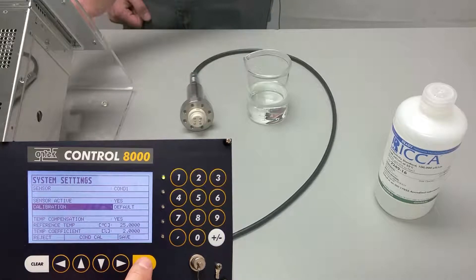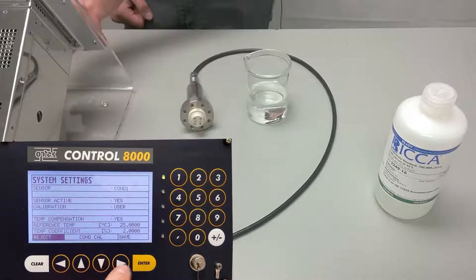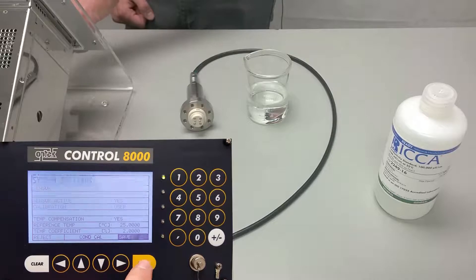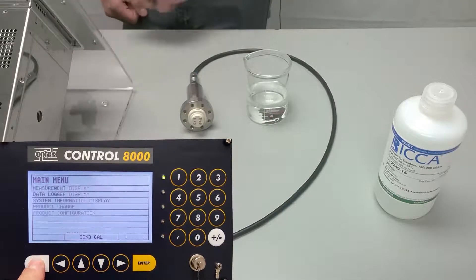We'll also change the calibration from the default factory calibration to the user calibration we are about to perform. Save the changes and press clear to get back to the main menu.